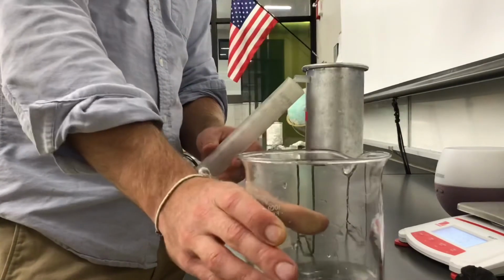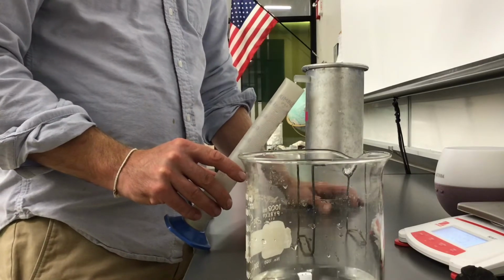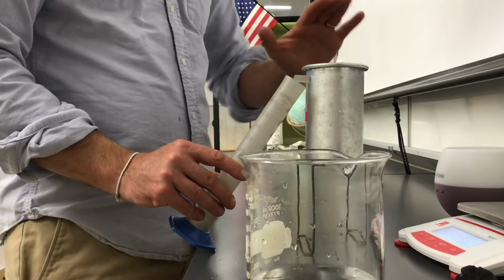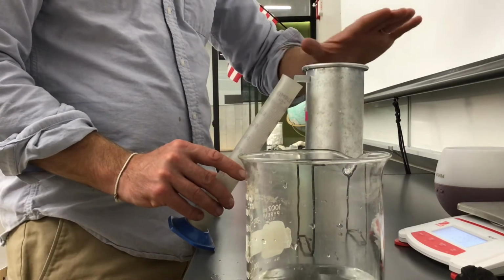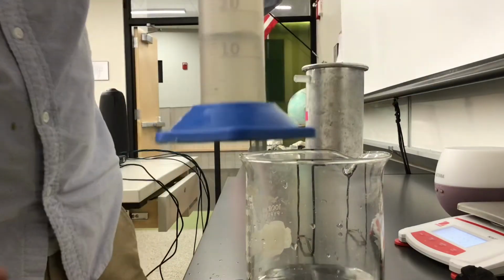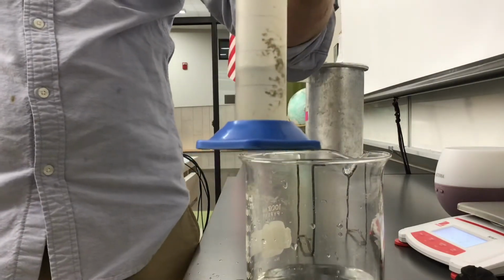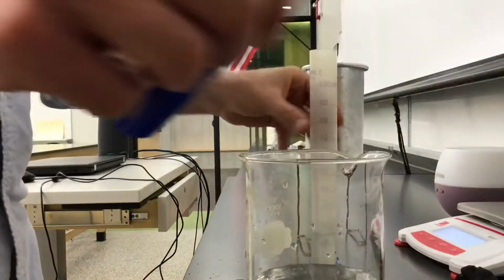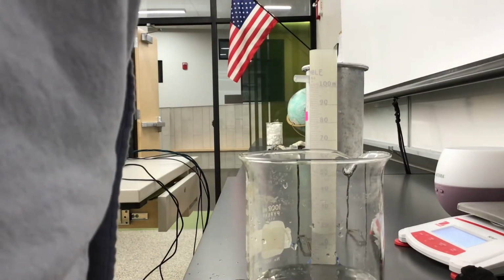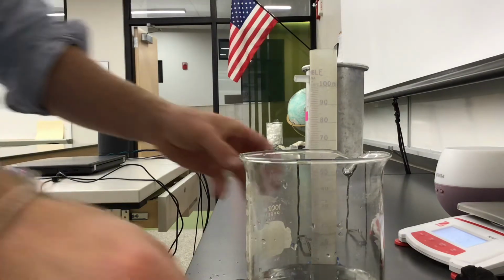Now I'm catching the water that does come out. Let it all dribble out. You've got to be real patient here. Let it go until it totally stops coming out. Basically what we're doing is creating a totally full bathtub right here. We're getting this absolutely full. Now I've got to note what this measurement is in this graduated cylinder. This has about 15 milliliters of water in it. That's going to be my initial volume. So I'm going to go back to my board here. I'm writing down 15 milliliters for my initial volume of basalt.